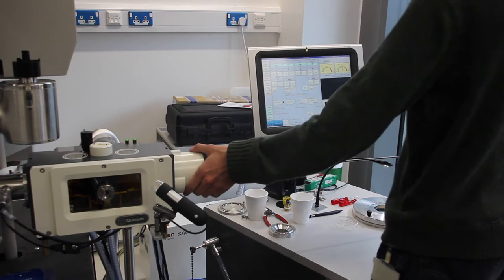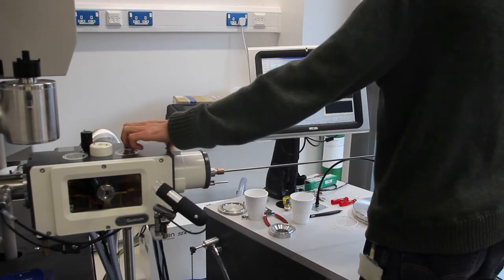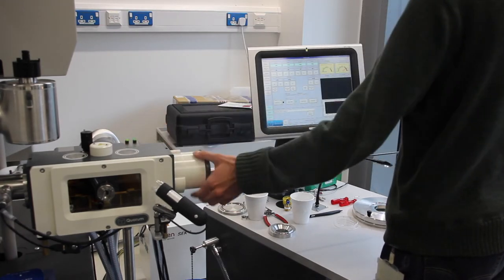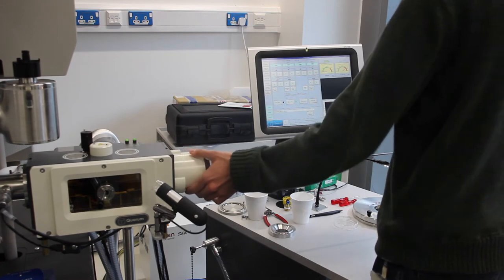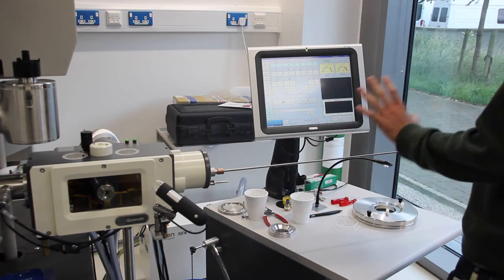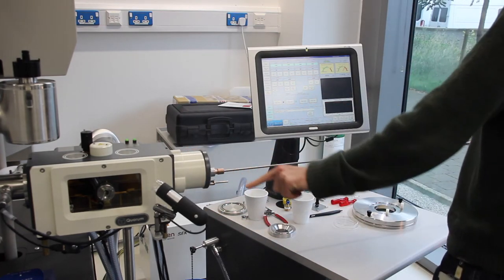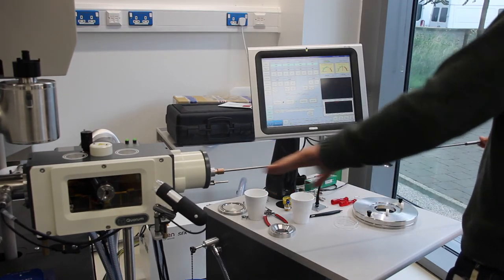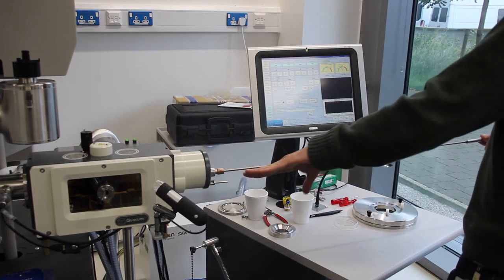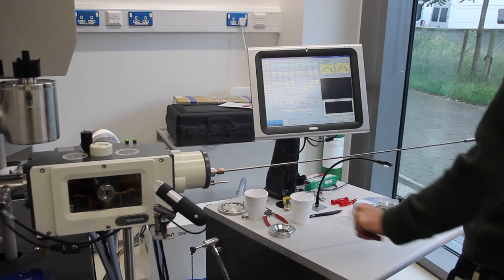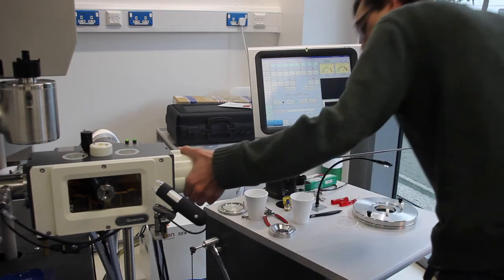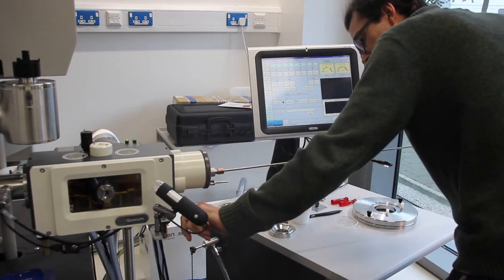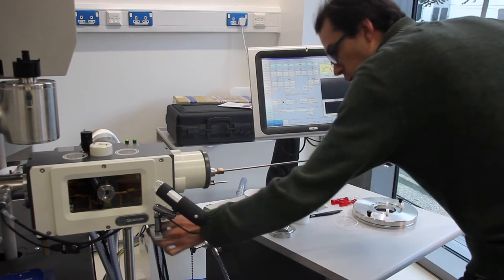It failed this time. Sometimes it will do that, so all you have to do is press pump again. While it's pumping, the shuttle should be in this vacuum area, so you want to keep this rod as straight as you can so that the shuttle isn't touching the sides. This green light indicates that it's reached the proper vacuum, and I can open this valve.